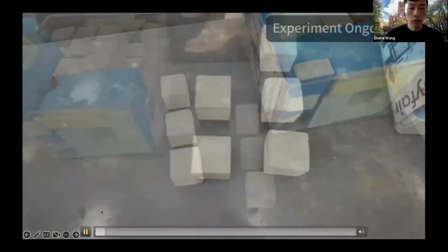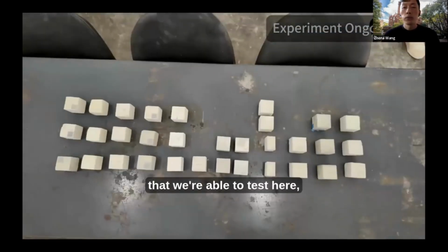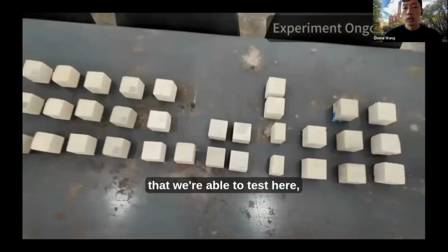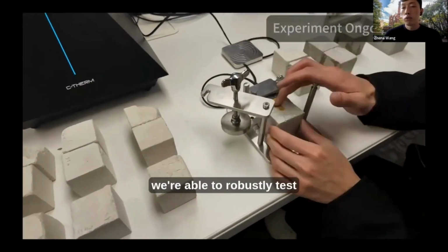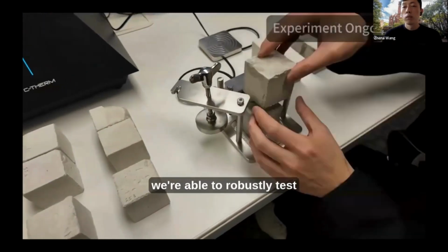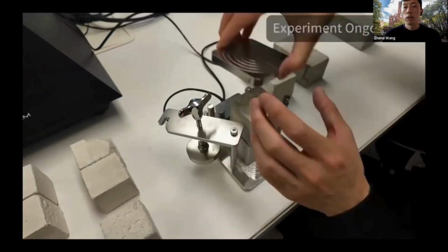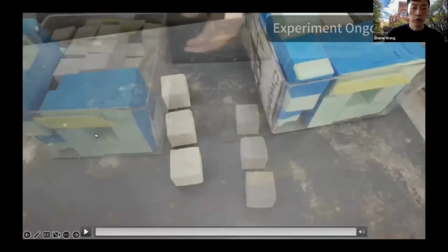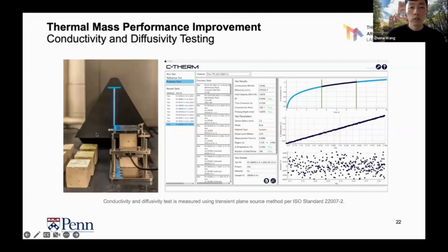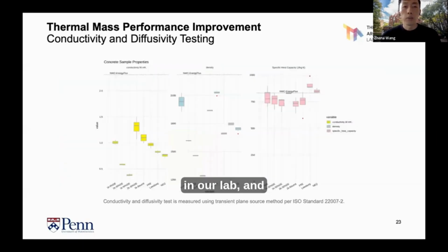So here is just a quick video showcasing a range of material samples that we're able to test here. And then with the help of the C-Therm instrument, we're able to robustly test the thermal properties of these samples with a high degree of precision. So here is just a quick glimpse of what that looks like in our lab.